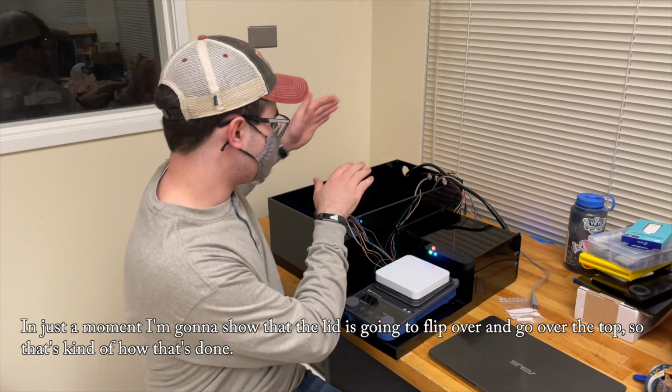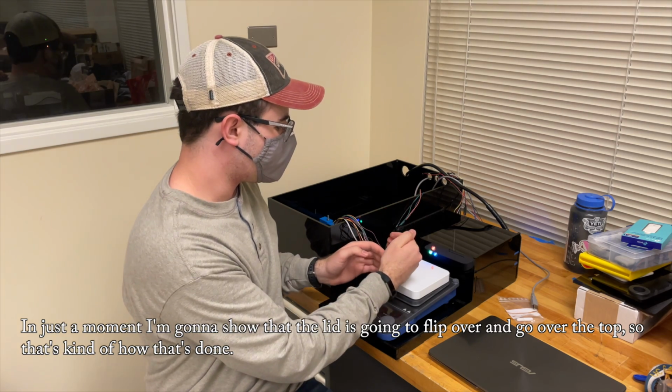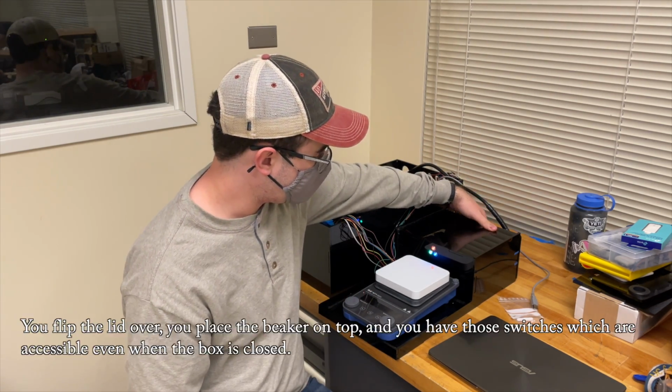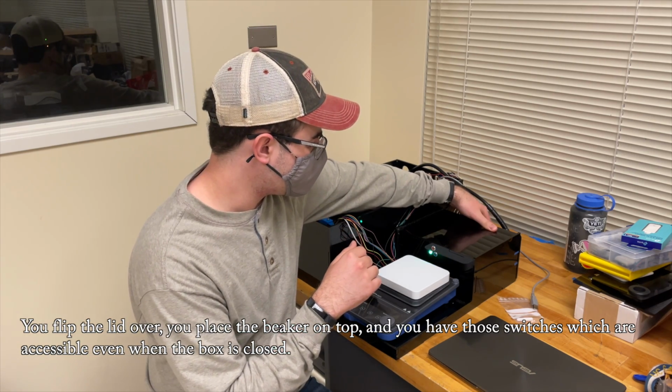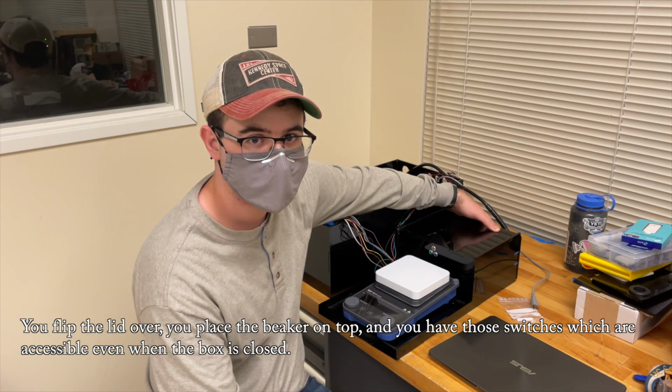In just a moment, I'm going to show that the lid is going to flip over and go over the top. So that's how that's done. You flip the lid over, you place the beaker on top, and you have those switches which are accessible even when the box is closed.